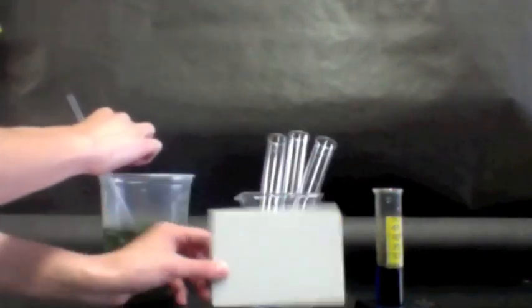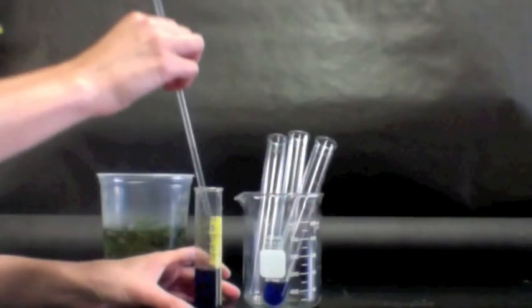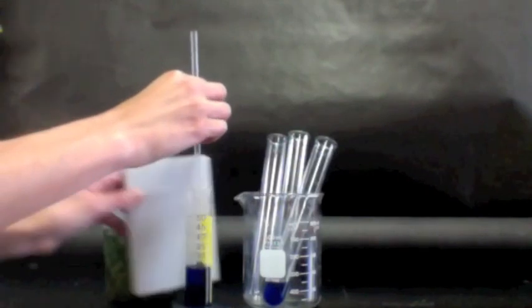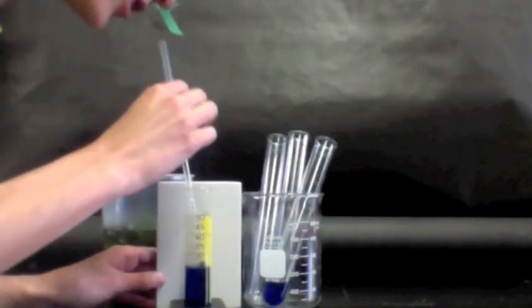Then I'm going to take a straw, and I'm going to blow into this. And as I blow into it, let's put something white behind it, you'll be able to see a color change.